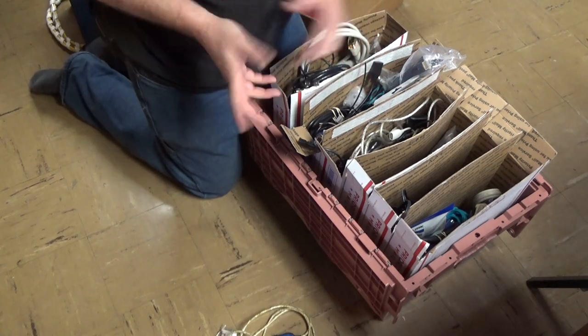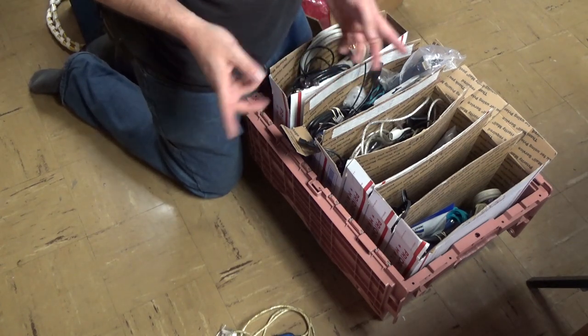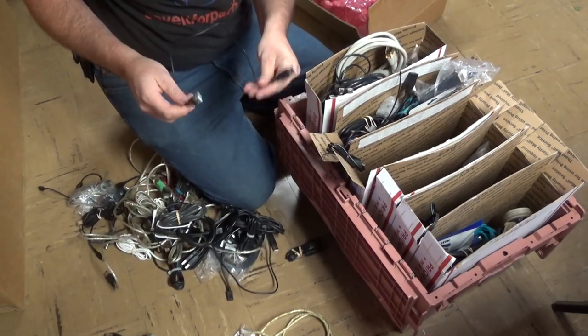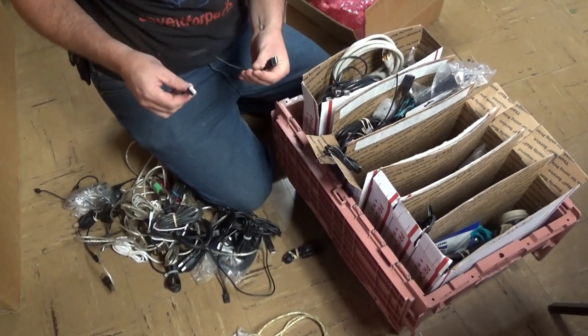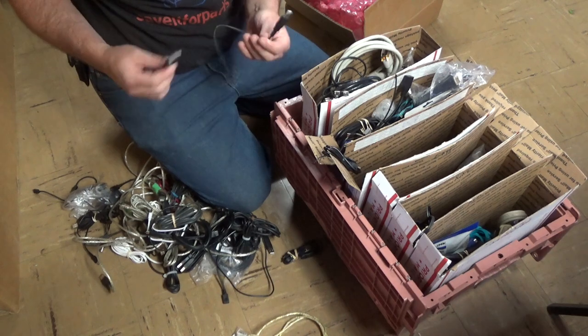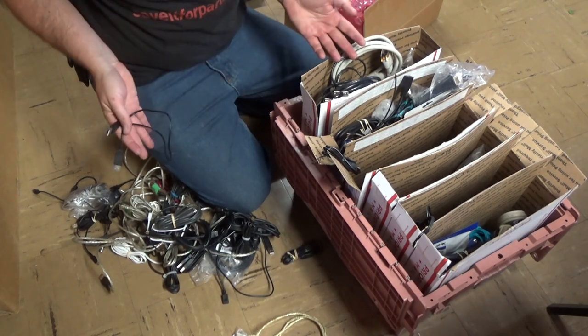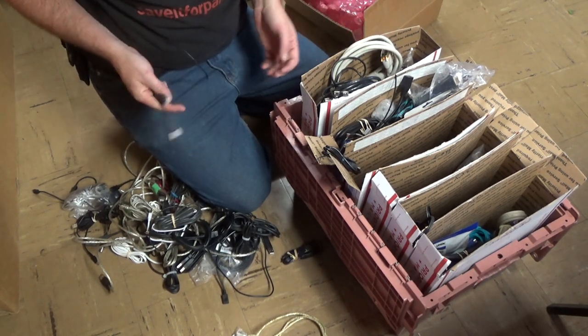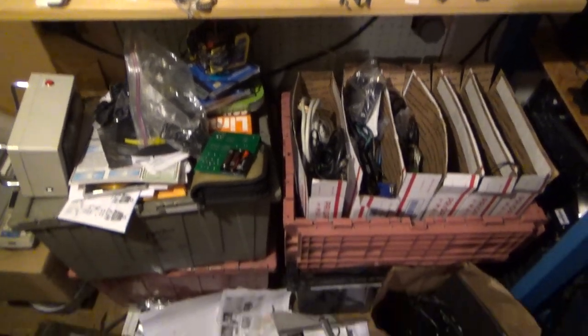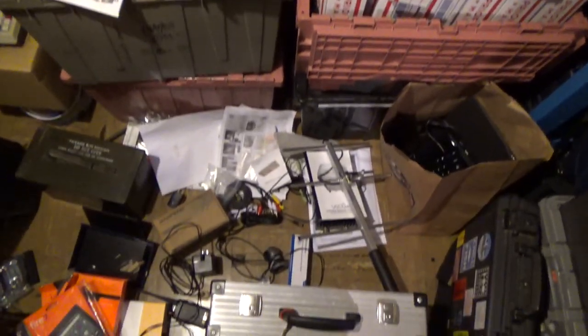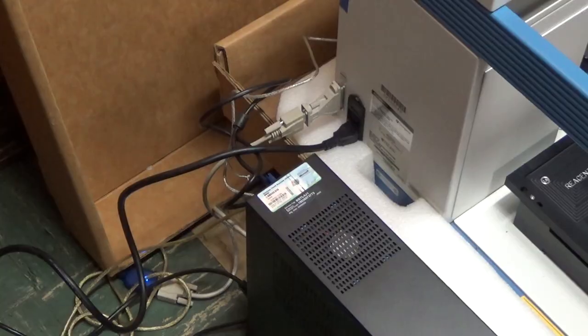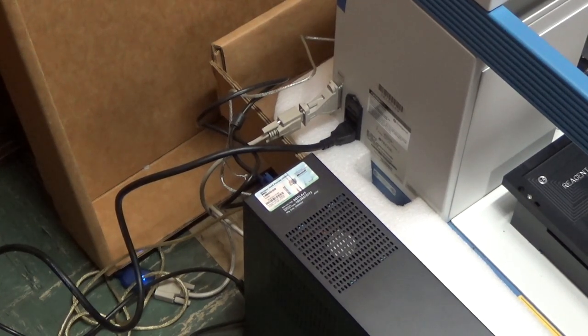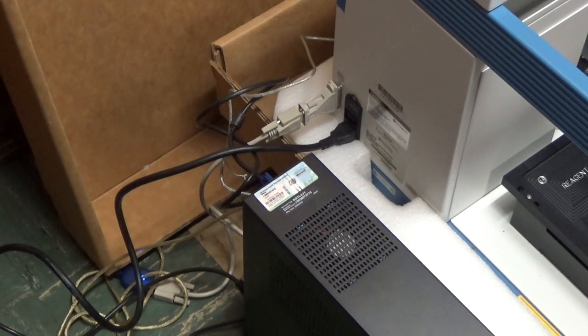So next, we need a weird double-ended USB cable that's just USB-A on both ends. Alright, there's one of those. Once again, save it for parts or professional hoarding saves the day. If you never throw anything away, you'll always have what you need. You might not be able to find it right away, especially if your work area looks like mine, but hey, at least you'll have it. Alright, we've got our pieced-together cable. Let's turn this thing on and see if it does stuff.